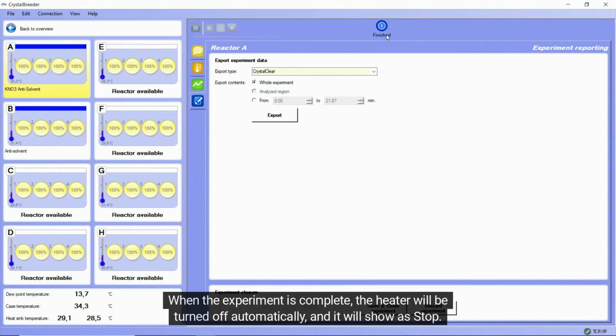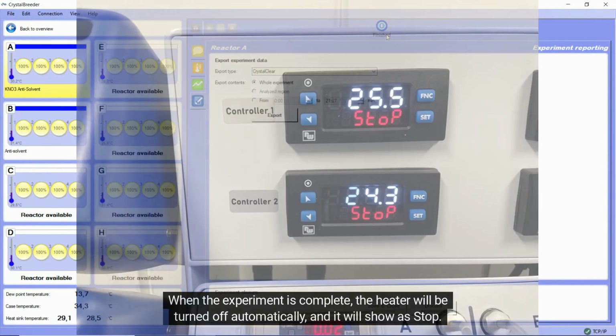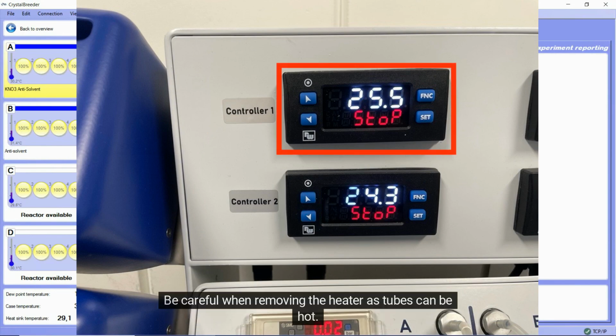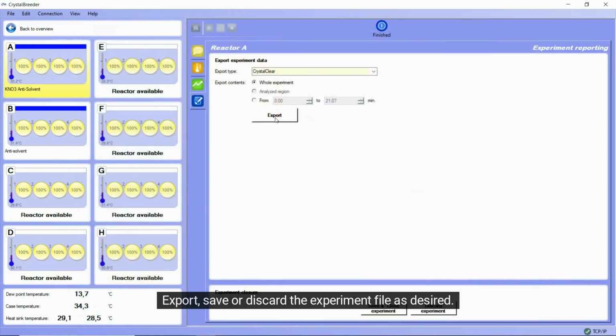When the experiment is complete, the heater will be turned off automatically, and it will show as stop. Be careful when removing the heater as tubes can be hot. Export, save or discard the experiment file as desired.